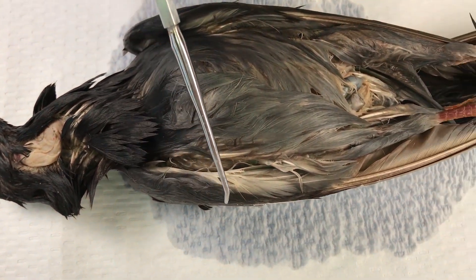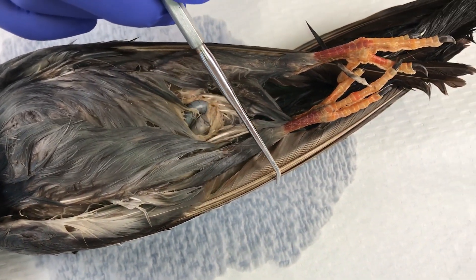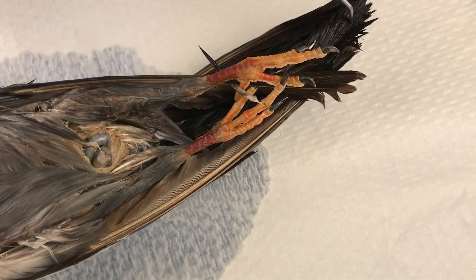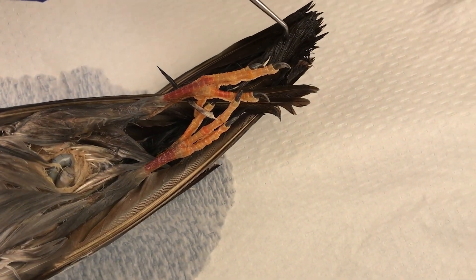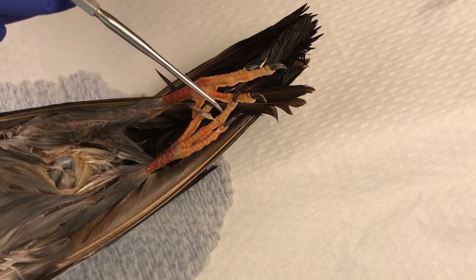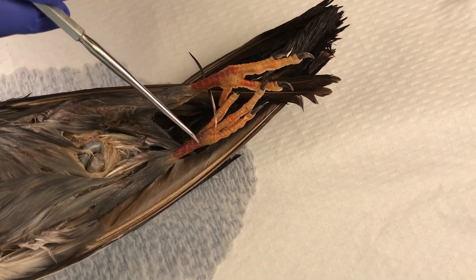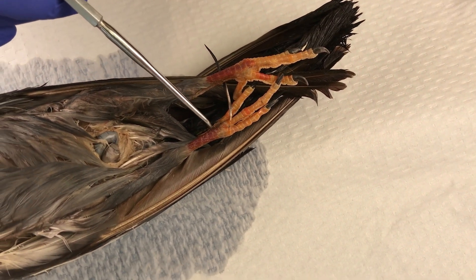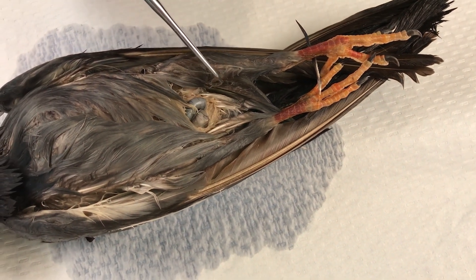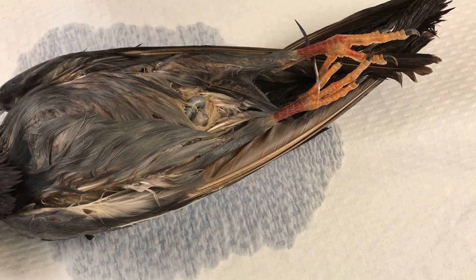We can see the wing of the animal as we work towards its posterior. We have the tail, and above the tail sits the feet that are covered in scales. We'll see this in another video, but there is the cloaca in this region here.